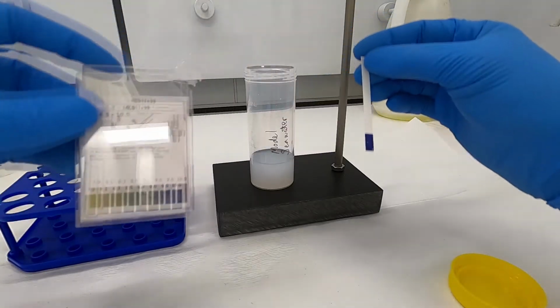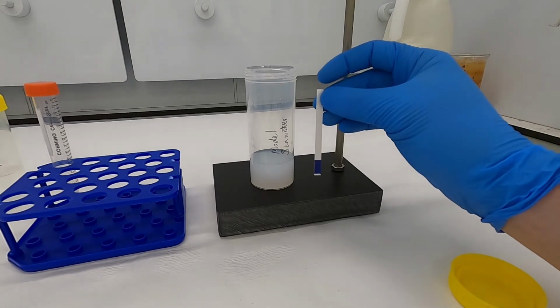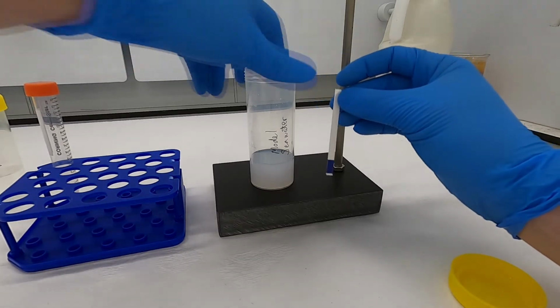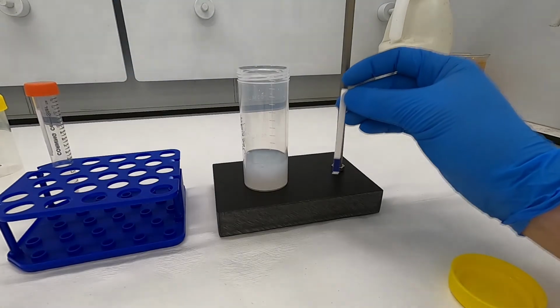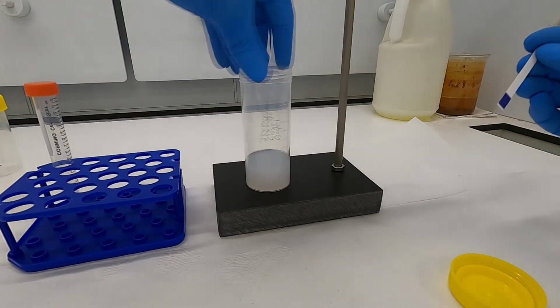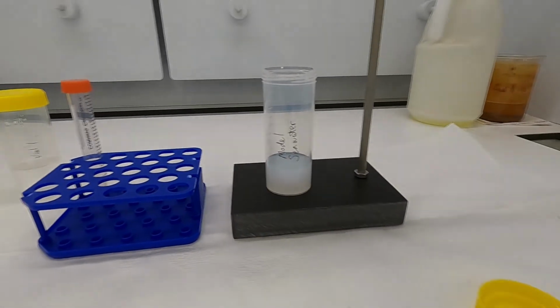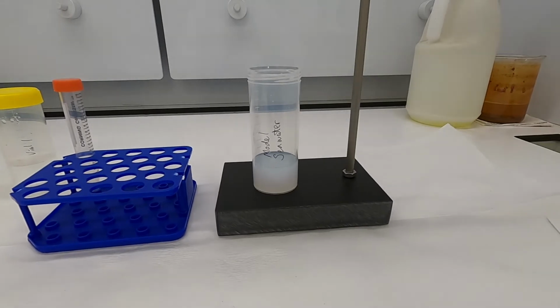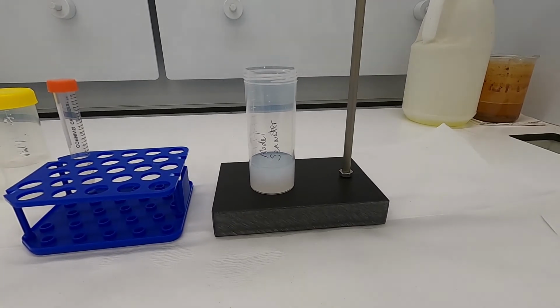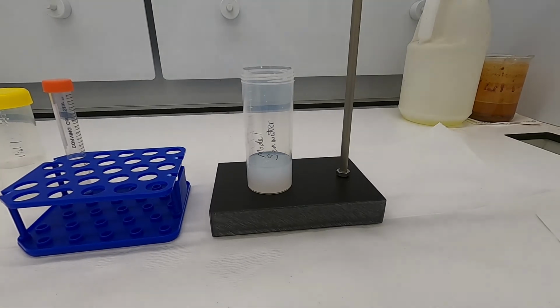top of our scale. Okay, so the point here is that the pH is more basic or alkaline rather than acidic, and we have a stable precipitate of calcium carbonate in that solution, which we can pretend are our lovely calcifying marine organisms. So what do you think happens if we increase the amount of carbon dioxide? You can presume, for example, the amount of CO2 in the atmosphere increases. That'll be absorbed by the ocean, and based on the previous demonstration, that should result in a decrease in the pH.